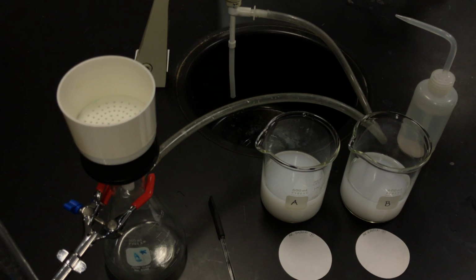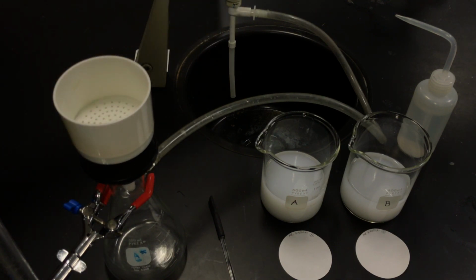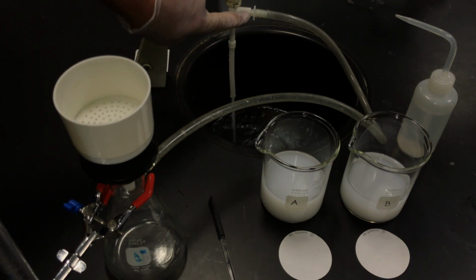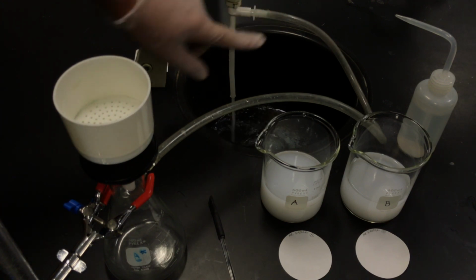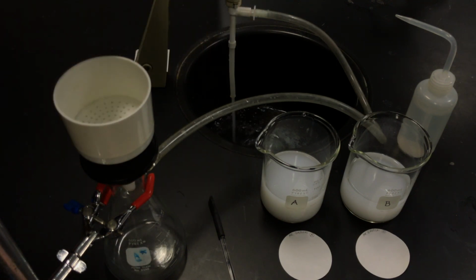So we're going to separate the precipitate using vacuum filtration. Particularly, we're going to use a Buchner funnel. And we've got an aspirator set up here. So this is a water spigot. And essentially by turning the water on, I'm running water straight through this little tube here. And what's happening is, by Bernoulli's principle, we're lowering the pressure. By making the water go in this direction downward, it's organizing the air and making the air push outward less, but essentially I'm creating a low pressure scenario in the tube and in the flask, and the high pressure is pushing down.